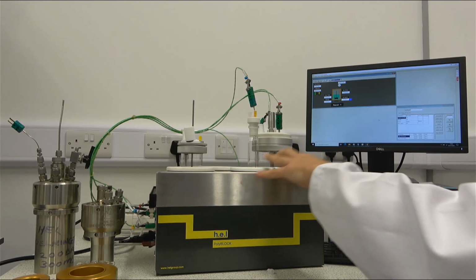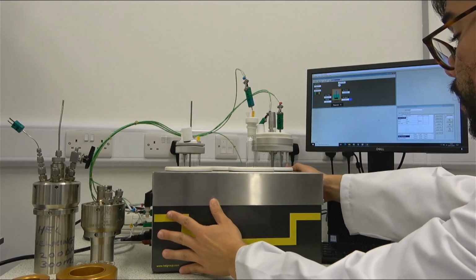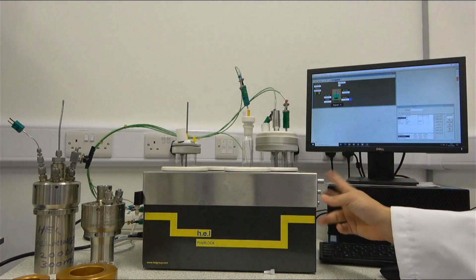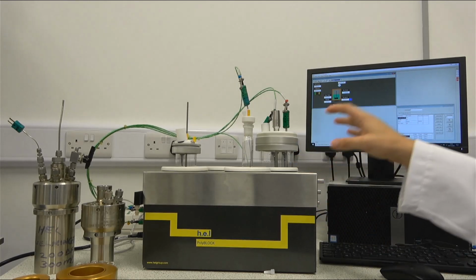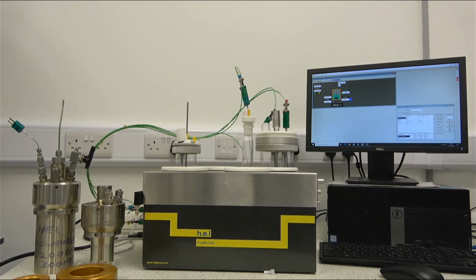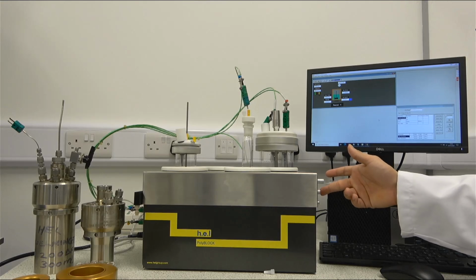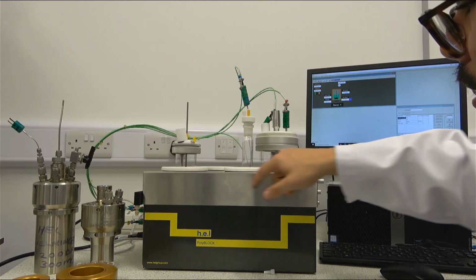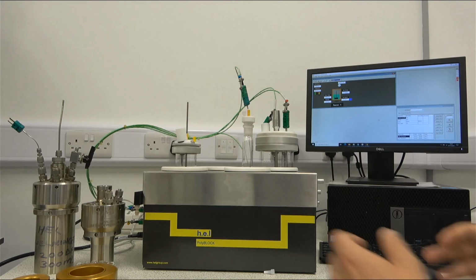reactors sit. But also we have other ways to control temperature. We can see here on the side, we have this double connection. This connection allows us to communicate our PolyBLOCK with circulators in order to cool down our reactions faster. In this case, we will have an oil or water, depending on the physical reactions and the physical parameters that we require for our reaction, in which the oil or the water is going to go in through this connection, and is going to go inside of the PolyBLOCK, coming out this way, helping us to regulate the temperature.